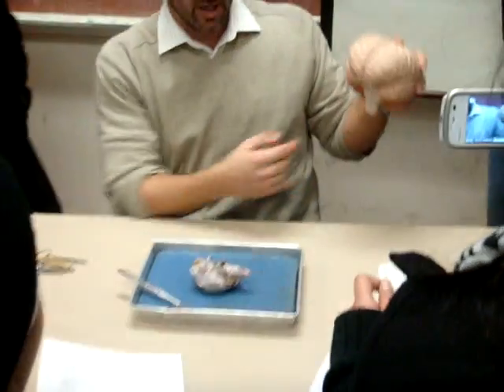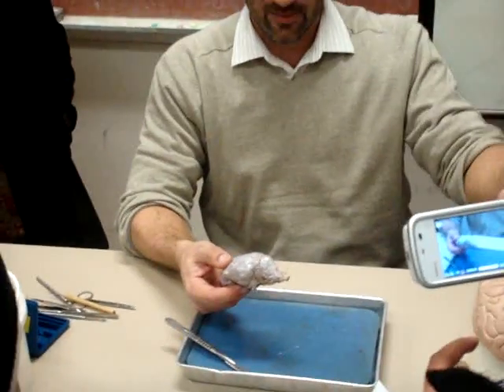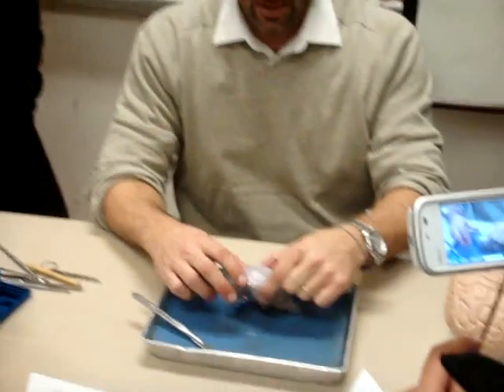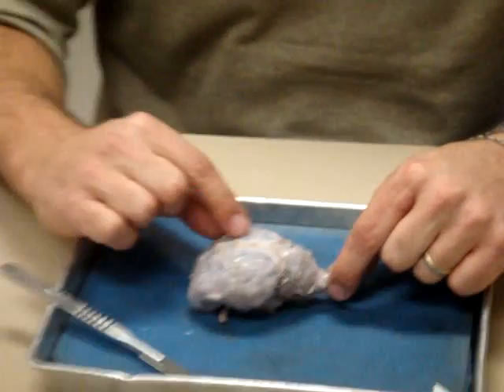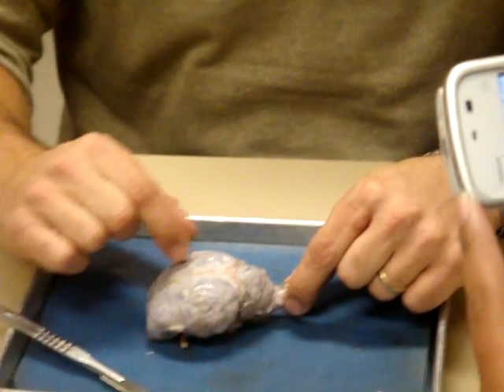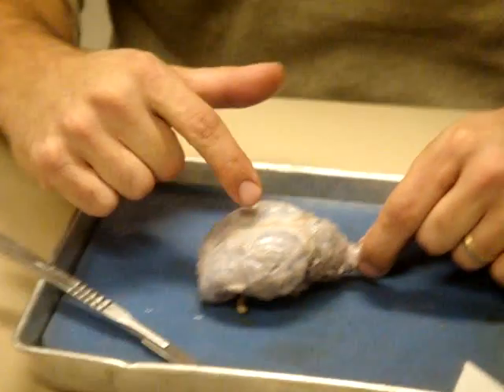Inferiorly down out of the brain, and when we look at the sheep, it comes posteriorly. It will go along their back, right? It comes out straight back. But you can see this dura mater. This is the meninges outside, so it's kind of see-through, but it's got that milky color to it. And you can see it covering, here's the two cerebral hemispheres.